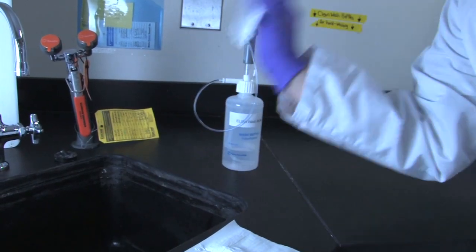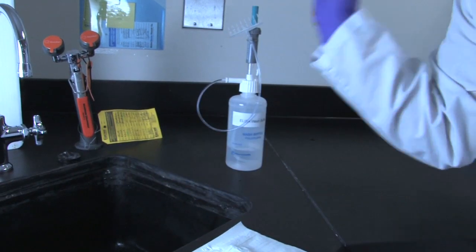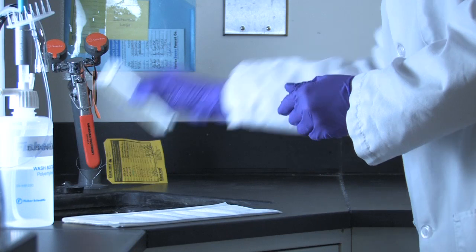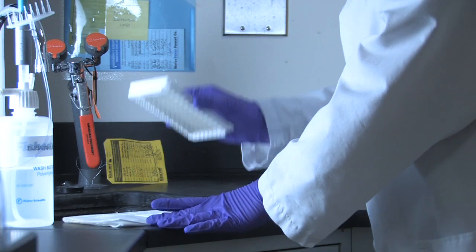Discard the contents of the wells using an angular and forceful motion. Due to surface tension, it is recommended to use the angle and motion shown in order to properly remove all liquid content.